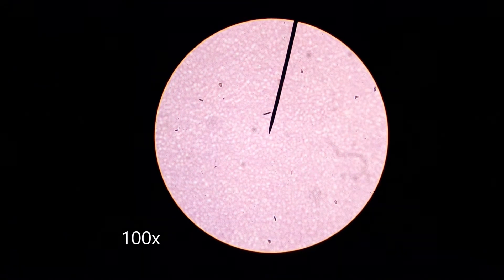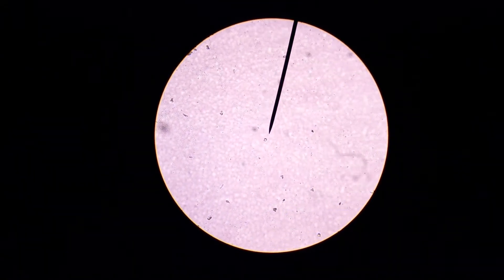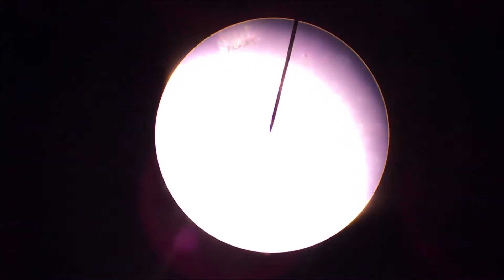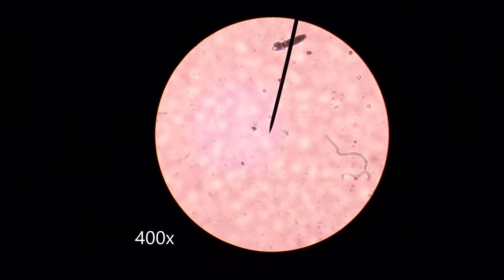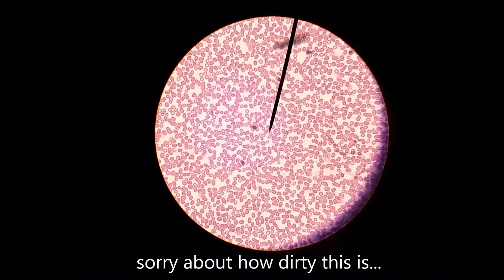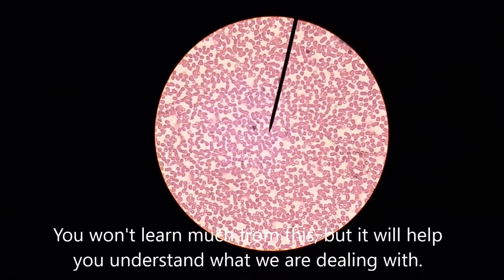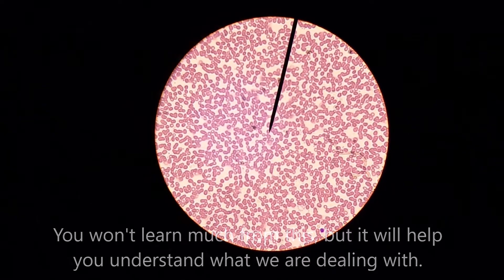Okay, blood cells. Imagine all these blood cells and then at higher power — see if I can get a little focus going here. Those are all blood cells and you can see them quite clearly — see if we can get a little zoom action going.